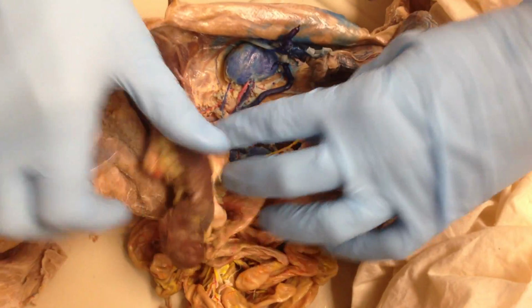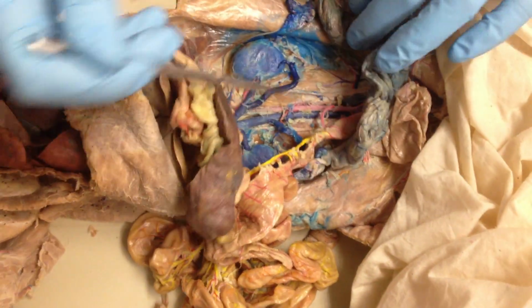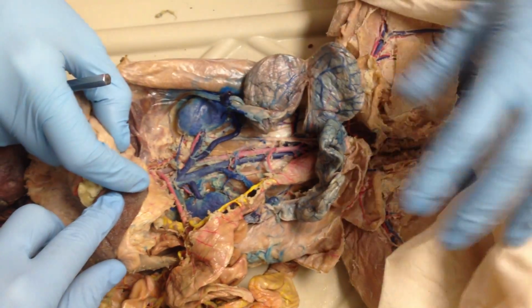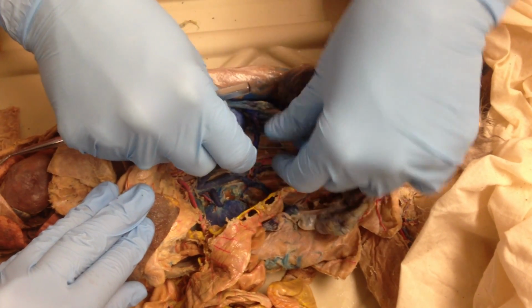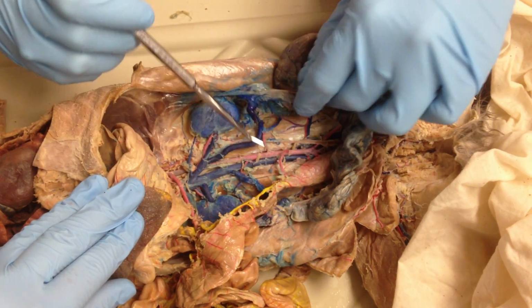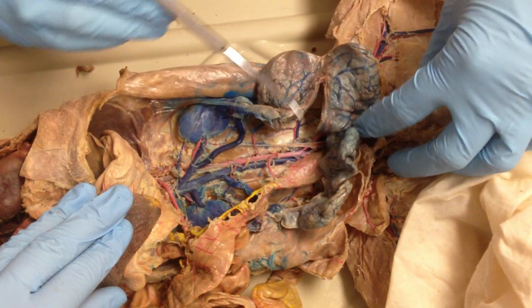And you get your posterior vena cava, and then your vessels that are coming to you, or in the case of the female, which are broken here. So that's your genital vein or ovarian vein in a female. And then the artery would have been this guy, which there was a blowout, so it's not attached.